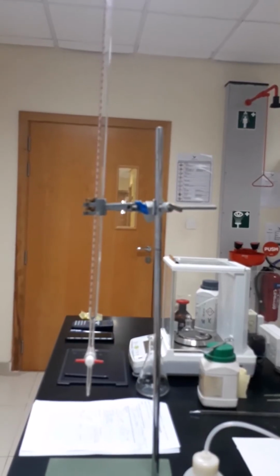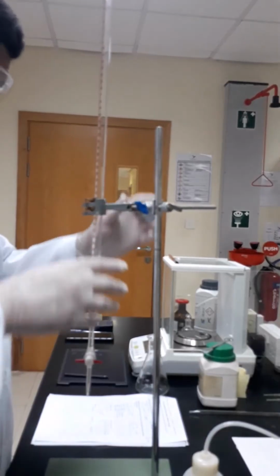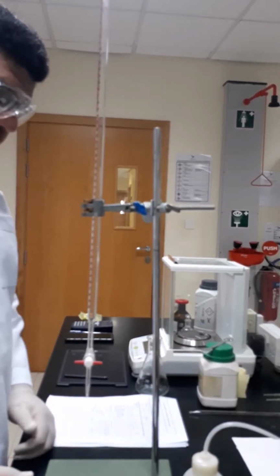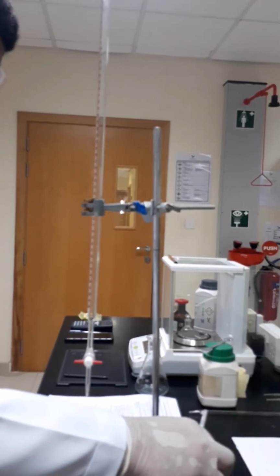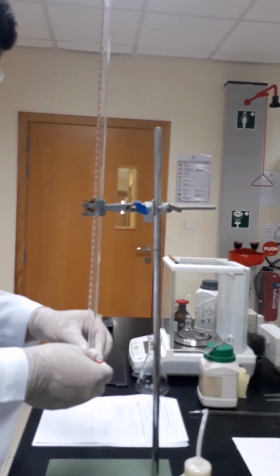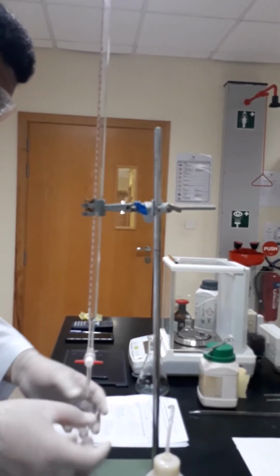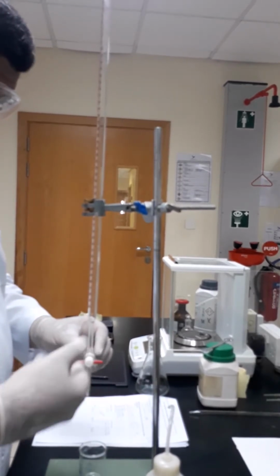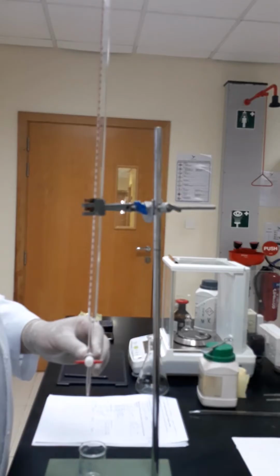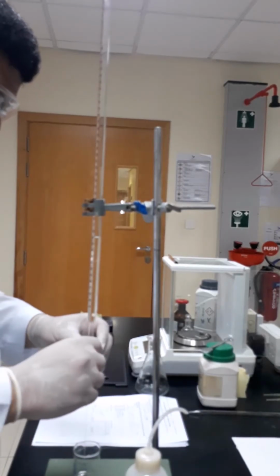Now we are going to proceed to titration. As we learned before, the first thing is to make sure that the entire system is positioned not too far and not too close. So we will start by cleaning the burette using the distilled water. We will use this beaker for general cleaning purposes. First of all, we will make sure that the valve is closed. Then we will add distilled water to clean the burette. Then we will allow it to flush out.